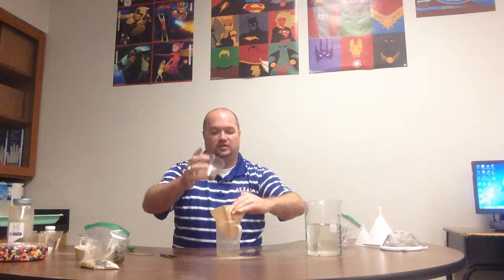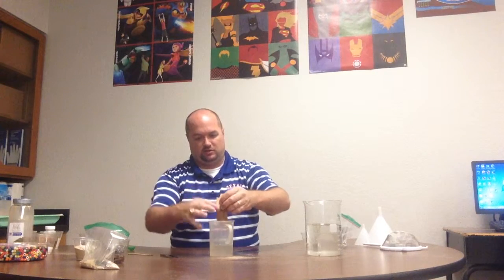So I could just leave it there. But I want the effect of seeing it in the filter. So I'm going to get as much of that sand in here as we can. Come on. Very cool. Alright, strain out our last little bit of water.